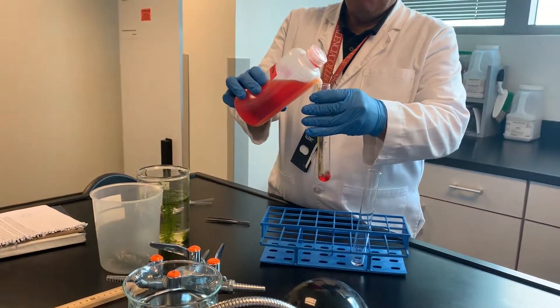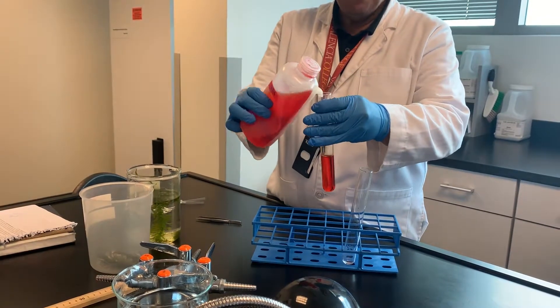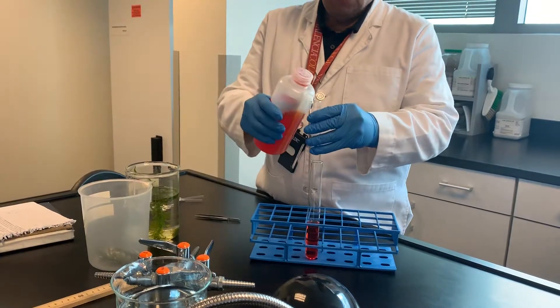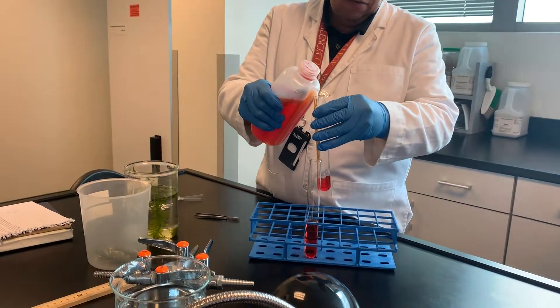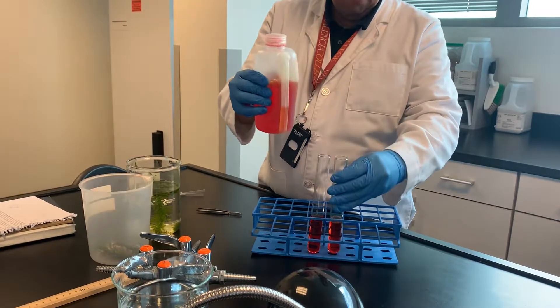So I'm going to add the phenol red to the tube first. Now this is not cellular respiration — I'm just reminding you of what we did with cellular respiration last week. This week we're doing photosynthesis, but we're using the same solution for a different purpose.